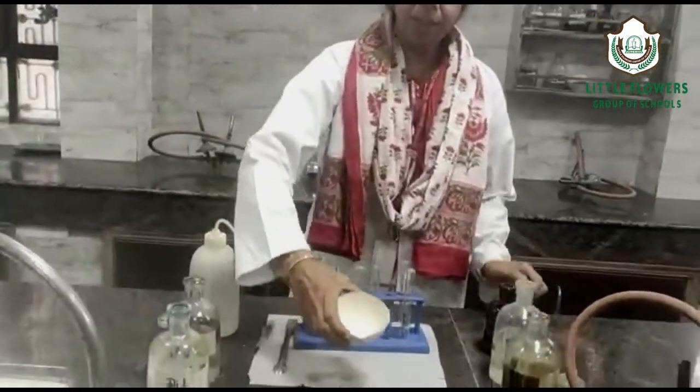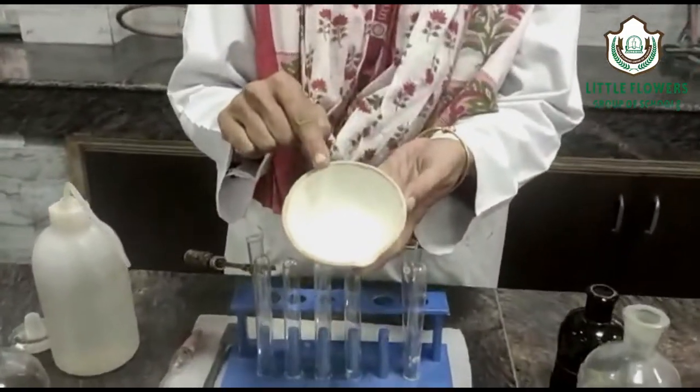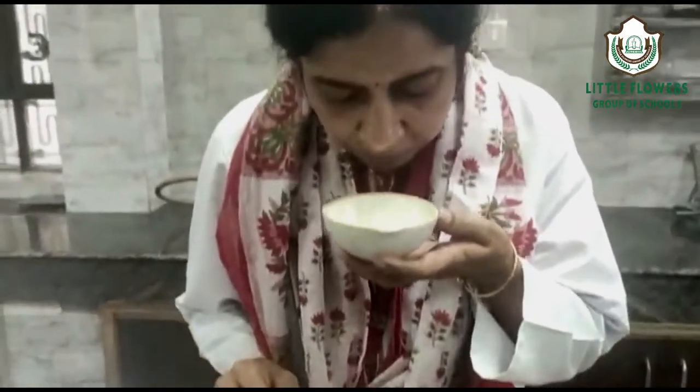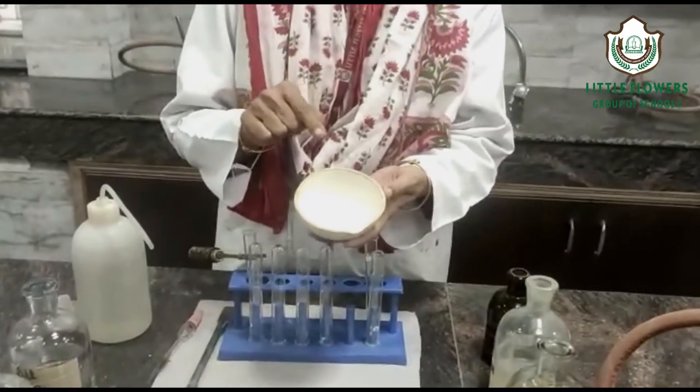Today we will do salt analysis. The aim is to analyze a given salt for the acidic radical. For physical observation, the color of the salt is white, it is odorless, and it is soluble.